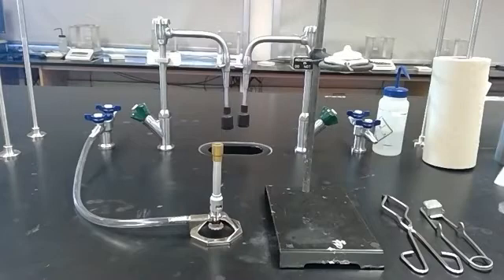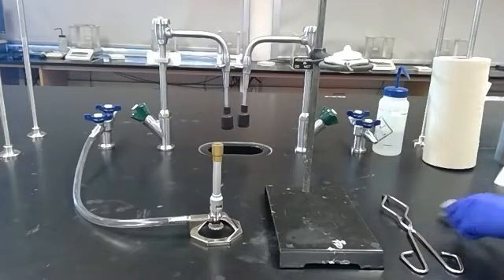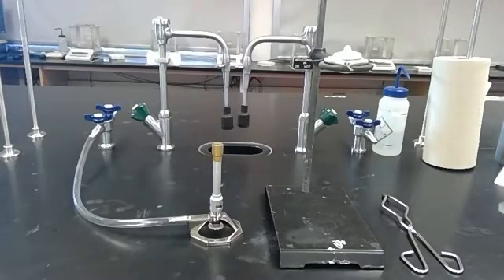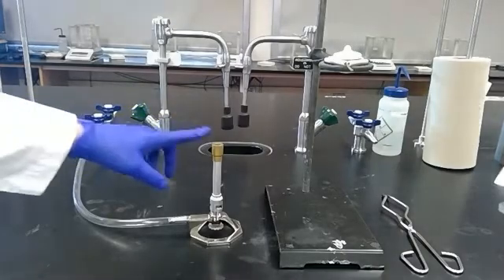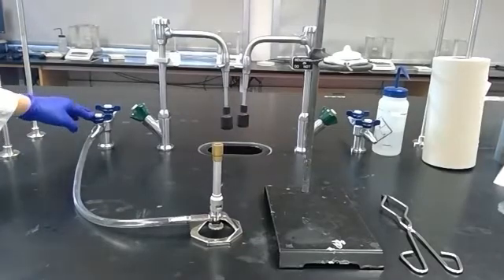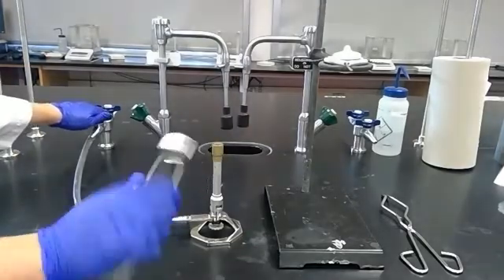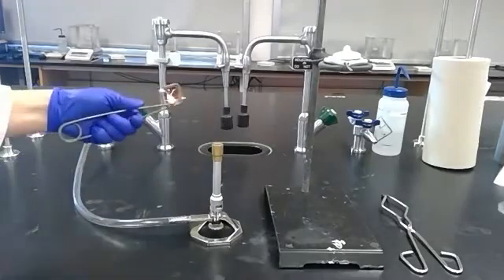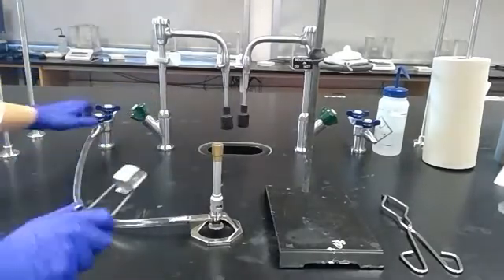Now I'm going to need to use a Bunsen burner with a flame, so I have my Bunsen burner right here connected to a gas line. I'm going to turn on the gas and use a striker like this to try to ignite my Bunsen burner.